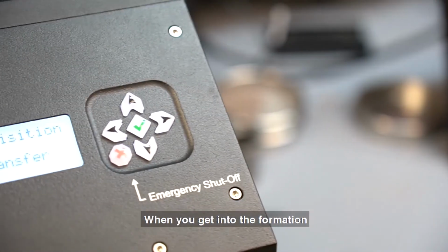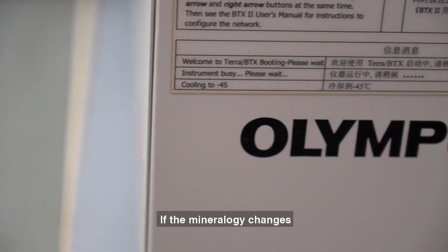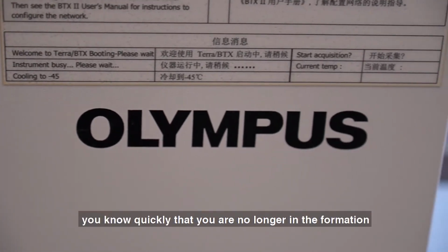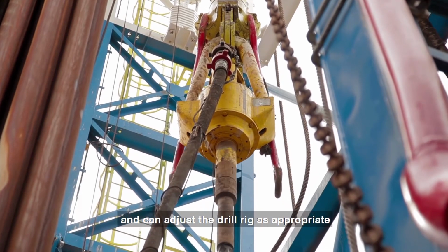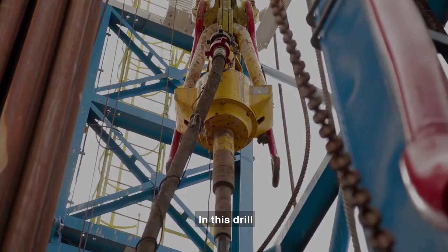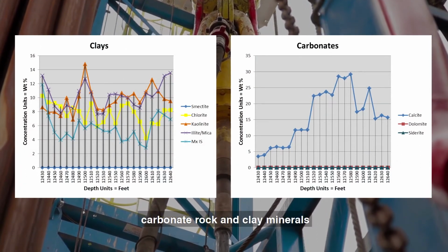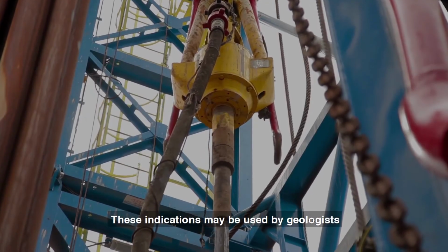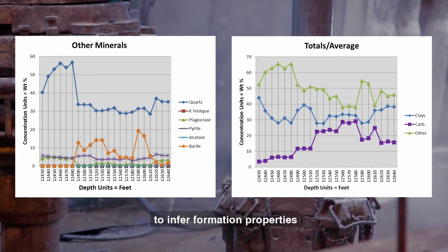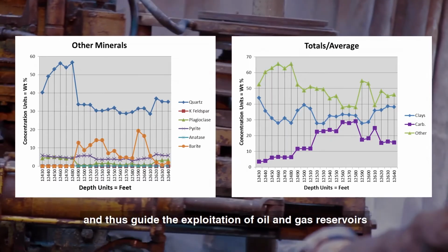When you get into the formation, spend a minute characterizing it, then take quick analysis on the following samples as you drill. If the mineralogy changes, you know quickly that you are no longer in the formation and can adjust the drill rig as appropriate. In this drill, the content of quartz, barytes, carbonate rock, and clay minerals varies significantly at different depths. These indications may be used by geologists to infer formation properties and thus guide the exploitation of oil and gas reservoirs.